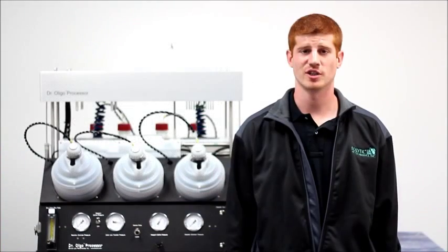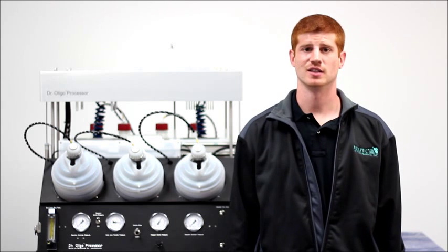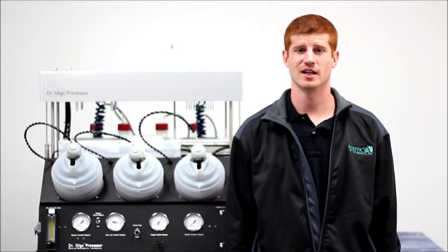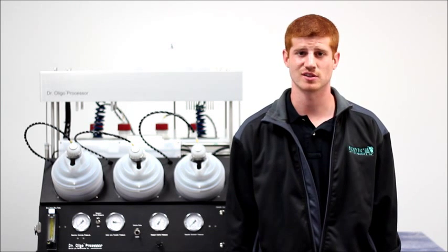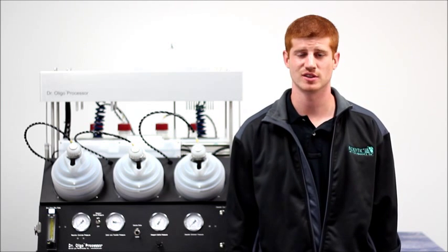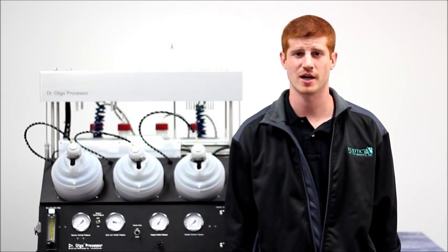The Dr. Oligo Processor automates purification and desalting procedures after synthesis. The instrument is highly cost and time effective because automating this process allows valuable resources to focus their time and efforts elsewhere. Operation costs are also greatly reduced from a reagent delivery system due to a unique 96-port distribution manifold designed by BioAutomation.